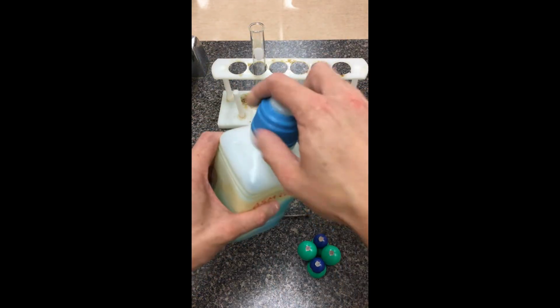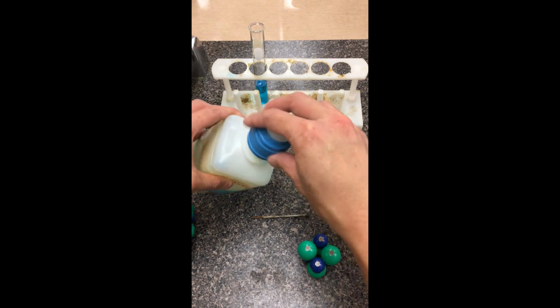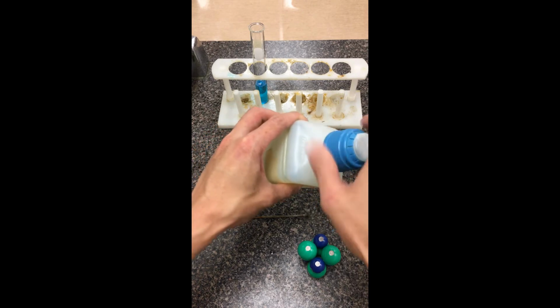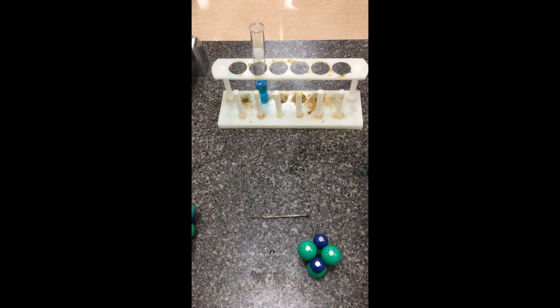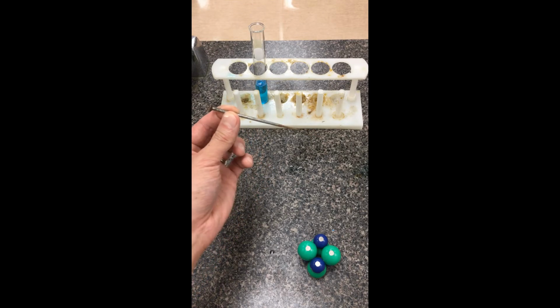I'm going to demonstrate this inside a test tube. We're going to watch the reaction as iron gets dropped into this copper sulfate solution. So I'm just going to fill up this test tube a little bit. Copper sulfate is already in solution here. It's no longer in the hydrate form. We have a piece of iron here. This is our iron nail. It's been used in previous years, so that's why it's been covered with a little bit of soot.